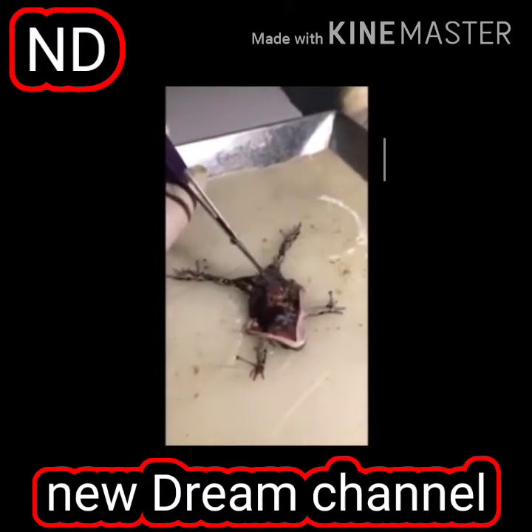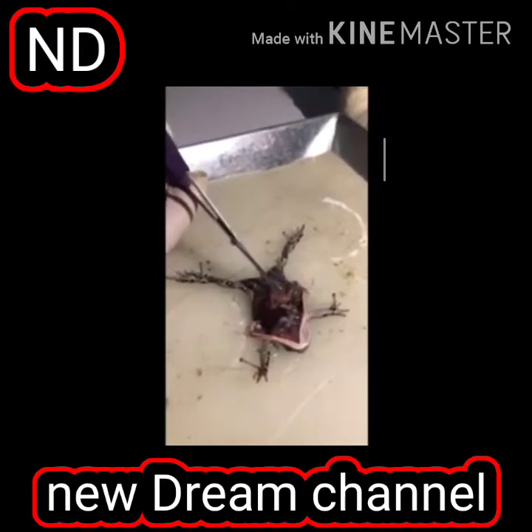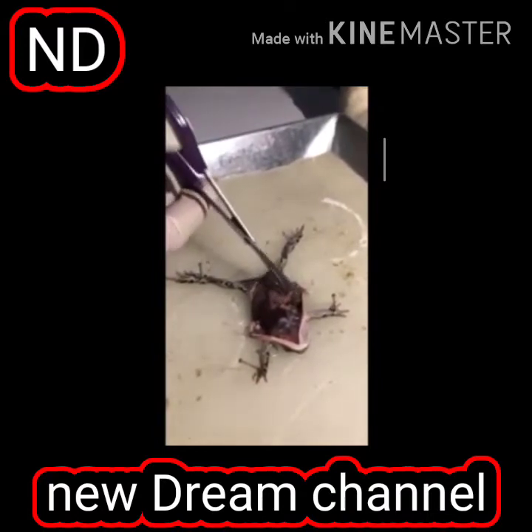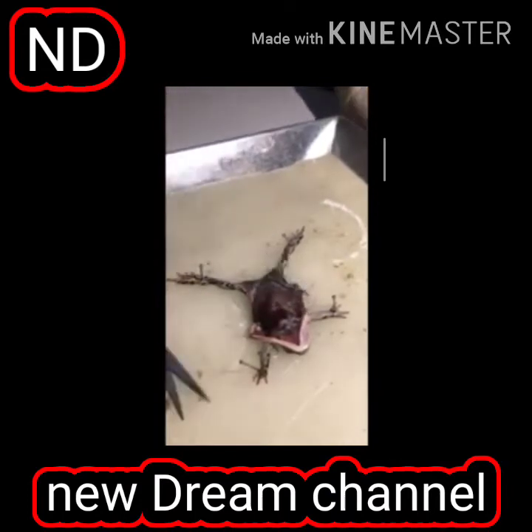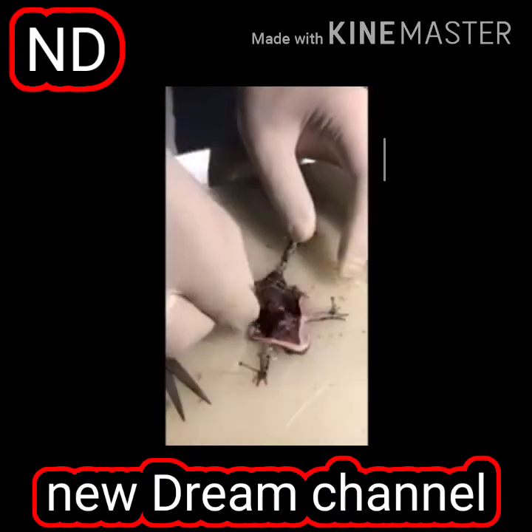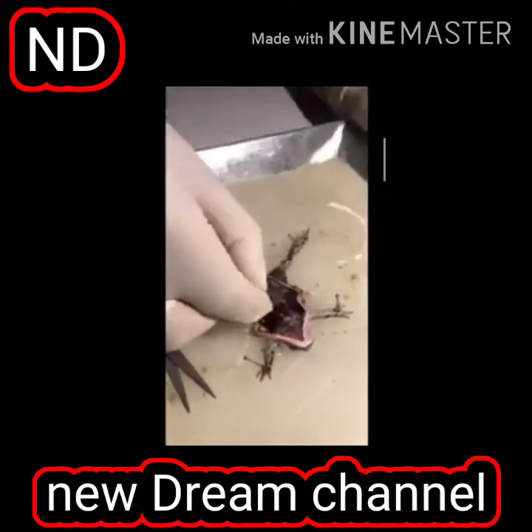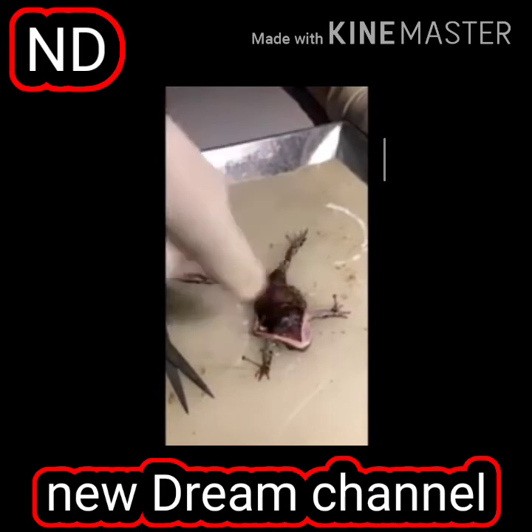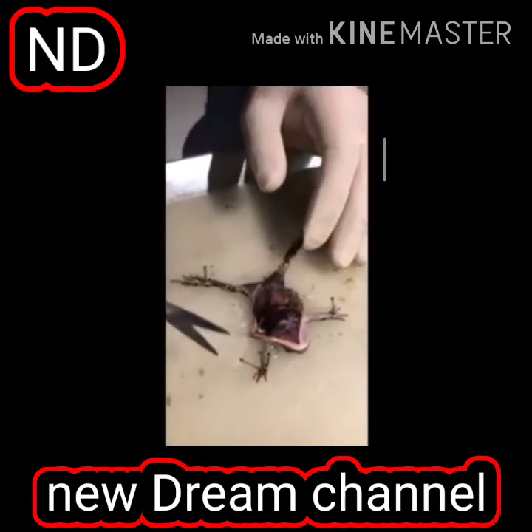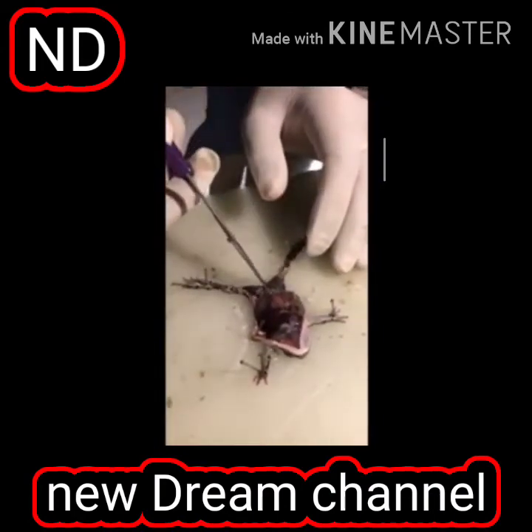And what you see, this is the stomach. Actual location of the stomach. And then it will lead to the duodenum. It will lead to the intestines. You can see the intestines here. If I take them, you can see the intestines here. They are coming down to the cloaca.